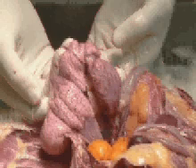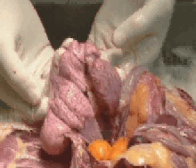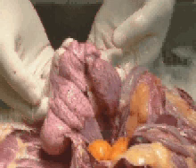This is a physiologically active oviduct. This hen is in full production and this is a normal size and shape of the oviduct.